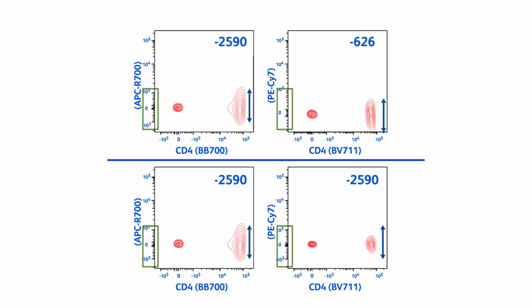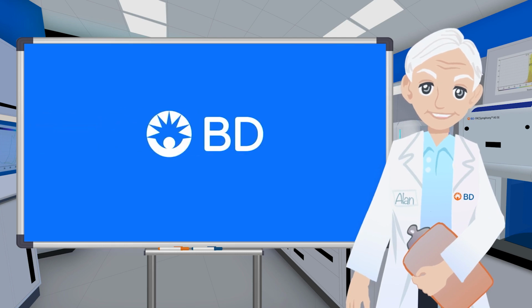In the top panel, the spread of positive populations looks very similar. However, adjusting the biexponential scales to be equivalent, we can easily see that the spread in the left panel is much greater than that on the right. Following these tips should help you get the best data from your important experiments.